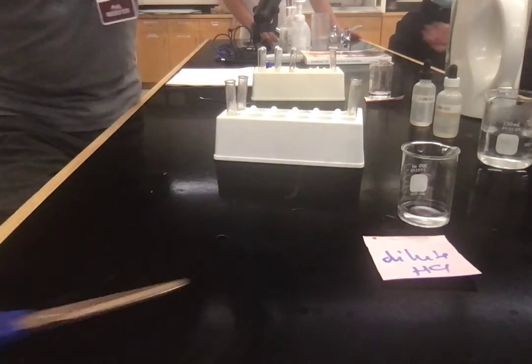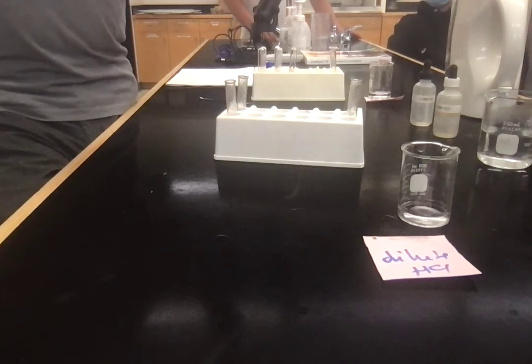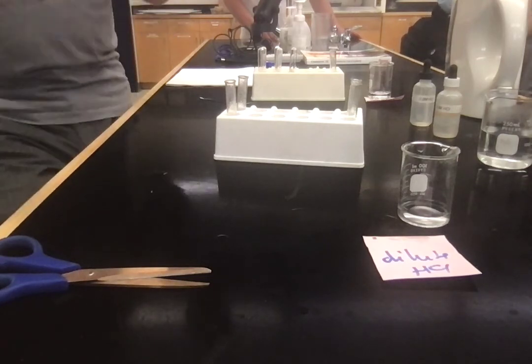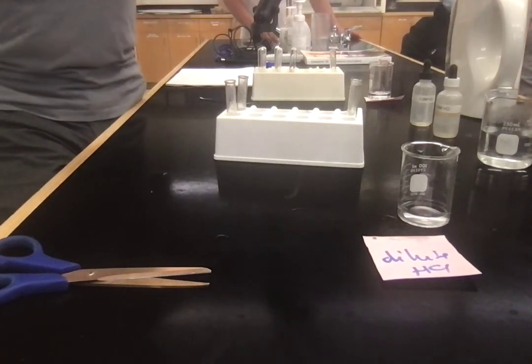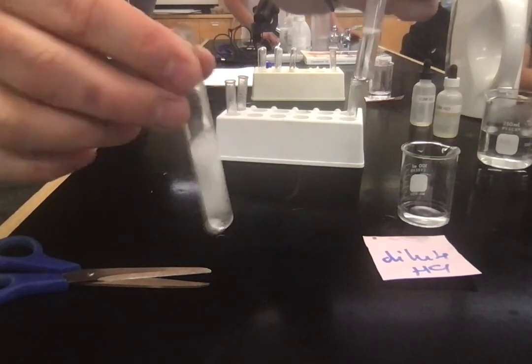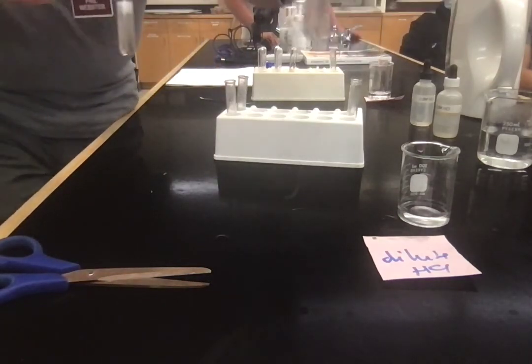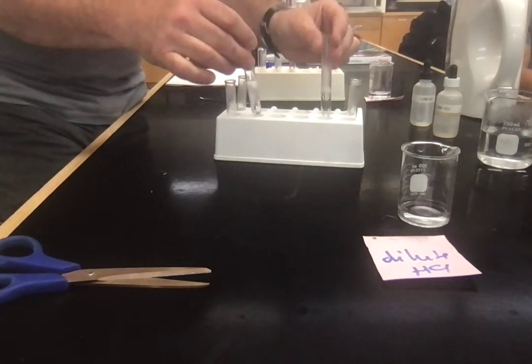I've actually left a little bit of magnesium at the top. Wouldn't want to do that, would I? Leaving magnesium. Nick, good job. No, that was me. That wasn't Nick. No, I think it was Nick's fault. Okay, so then we've got high surface area, low surface area, going slower.